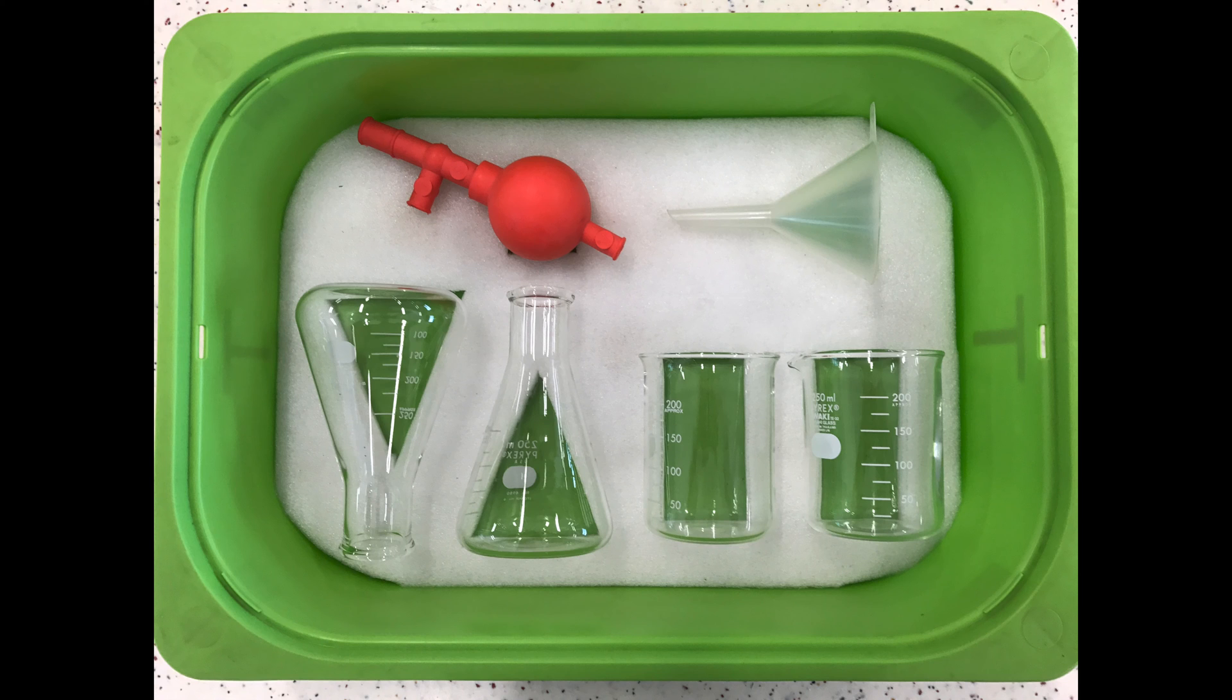We will use the conical flask for titration. So before we start, we will have to wash the conical flask with deionized water only.